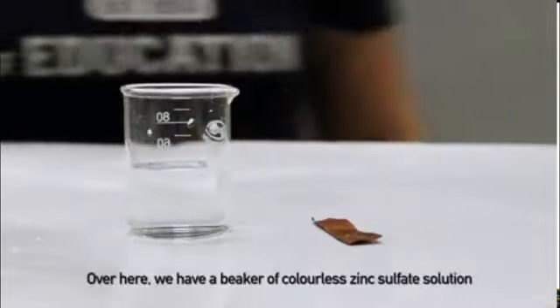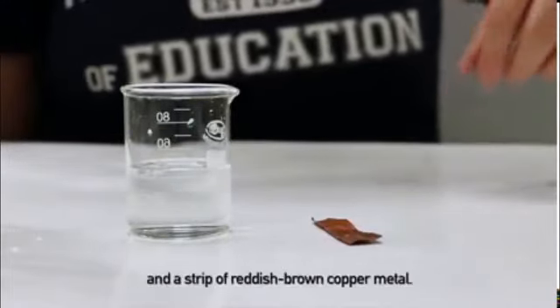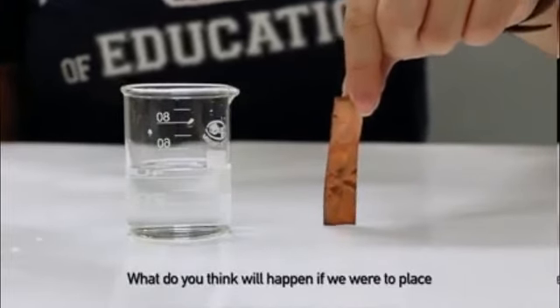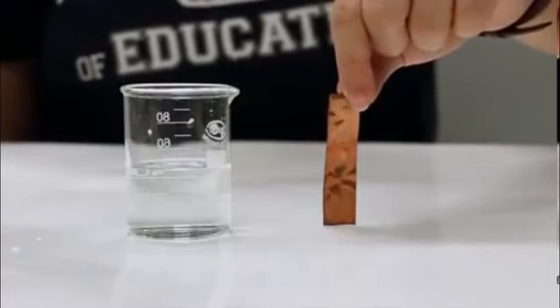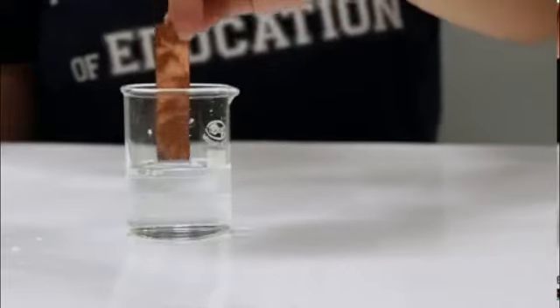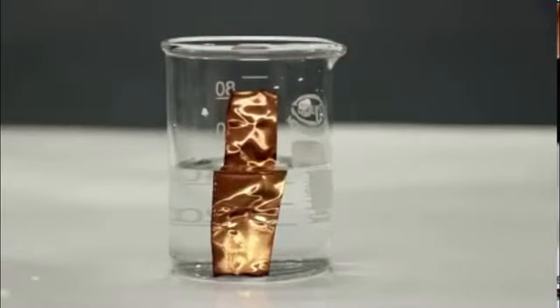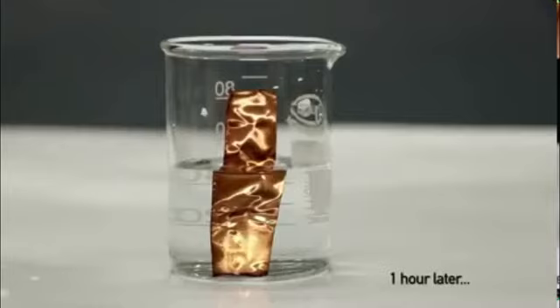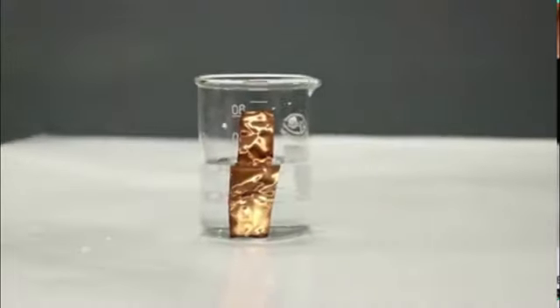Next activity: we have a beaker of zinc sulphate solution. Add a strip of reddish brown copper metal. Let's check what happens when this copper strip is placed in zinc sulphate solution. Keep it for one hour. We observe that there is no change — there is no reaction between copper and zinc sulphate.